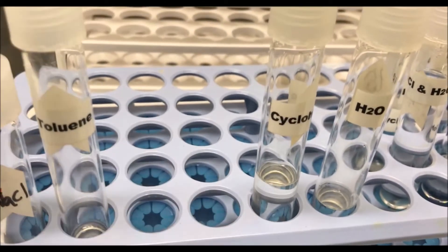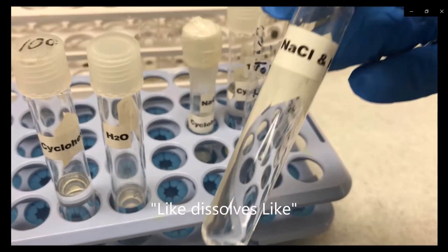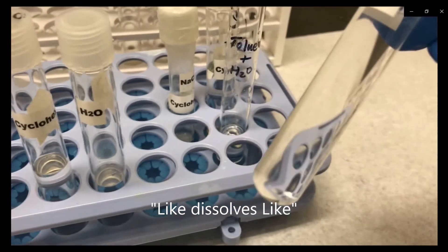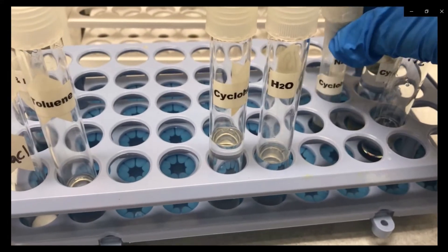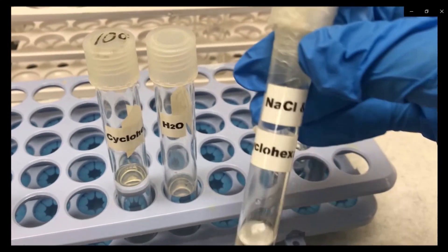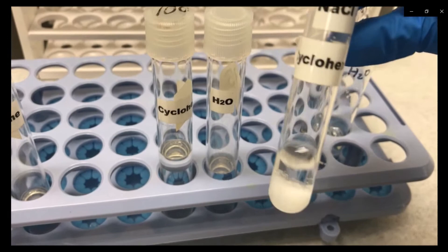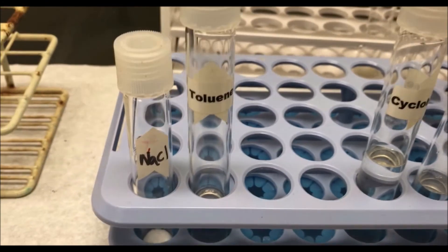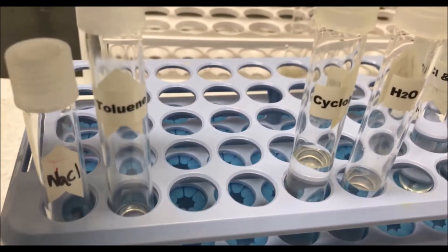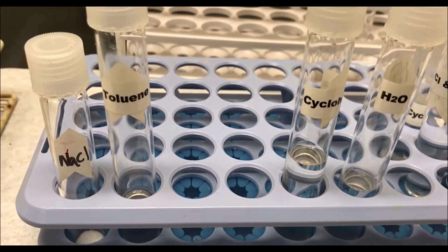Most inorganic compounds are ionic and soluble in water, a polar solvent. Sodium chloride dissolves completely in water, but is not soluble in cyclohexane, an organic solvent. Organic compounds are typically non-polar and thus are not soluble in water, but are soluble in organic solvents, as they are both non-polar. The general rule of solubility is: like dissolves like.